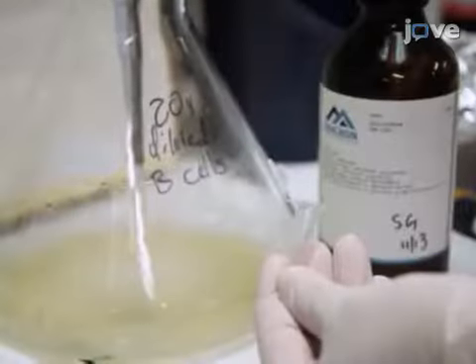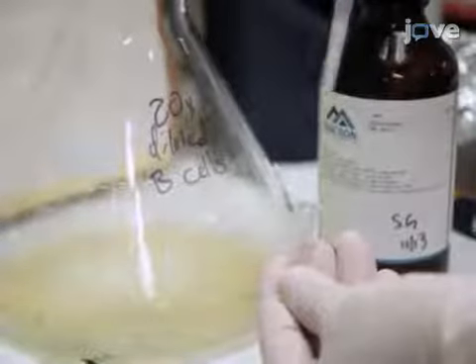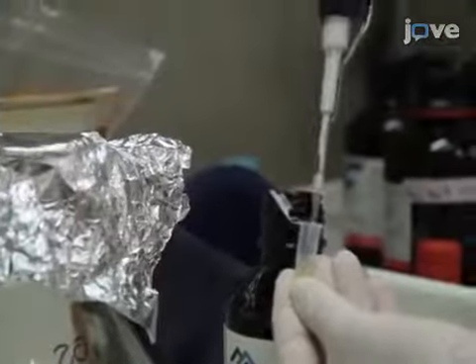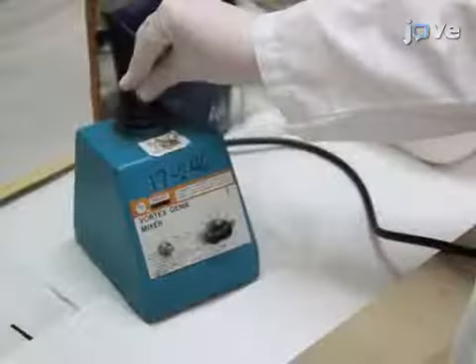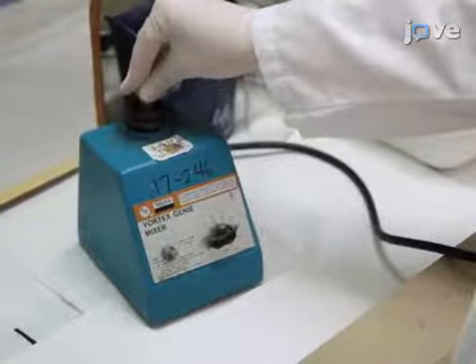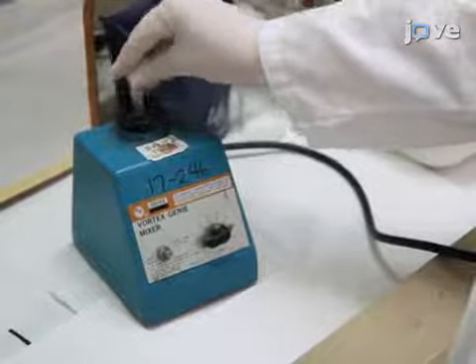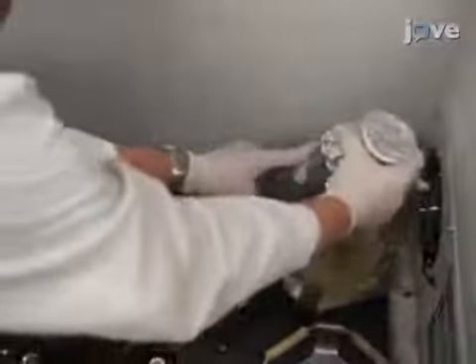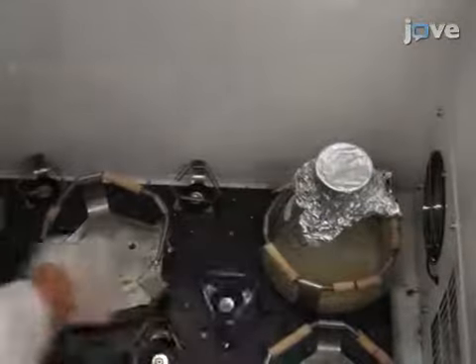To test for full infection, take a 500 microliter sample into a 1.5 milliliter tube and add 10 microliters of chloroform. Immediately vortex the mixture at high speed and observe if the solution clarifies, which indicates phage infection. Once the cells are fully infected, incubate for another 2 hours.